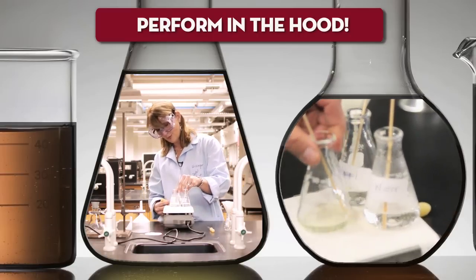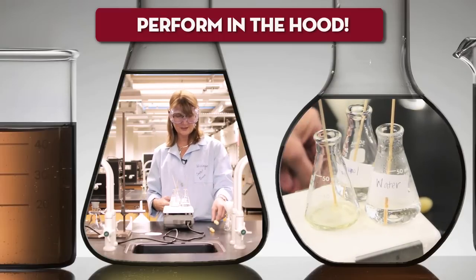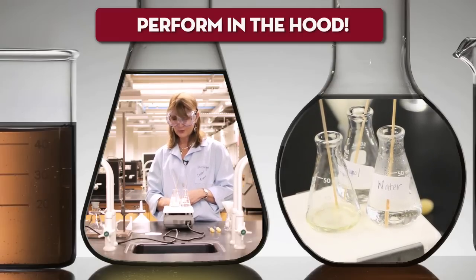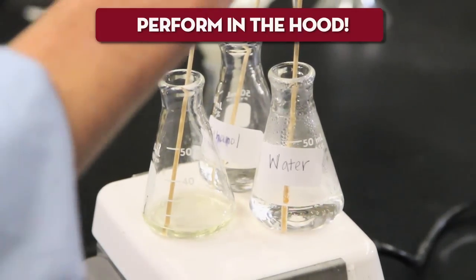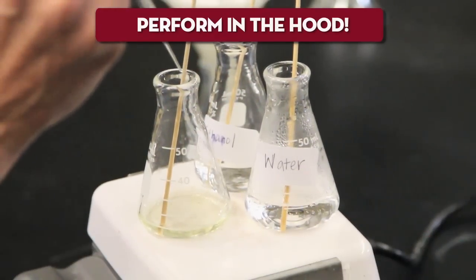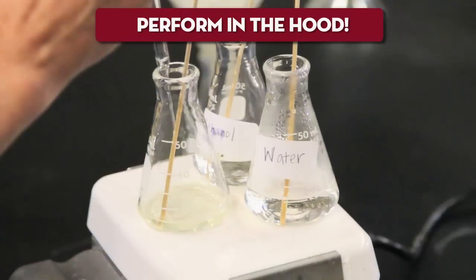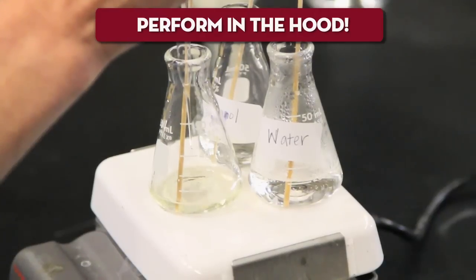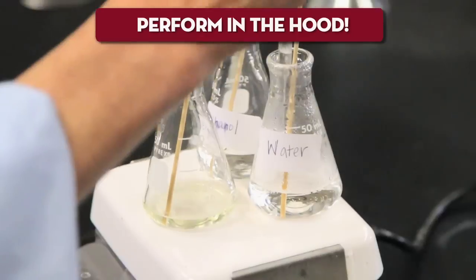In this case we have a nice clear solution, and I'm now ready to add some of the solvent that will form the right mixture to allow the crystals to come out at room temperature or cold in an ice bath. I'm going to add some water — it's a trial and error process. As you add drops of the solvent that the product is not soluble in, you can see some cloudiness that dissipates, which I can see as I'm adding water to the ethanol solution.